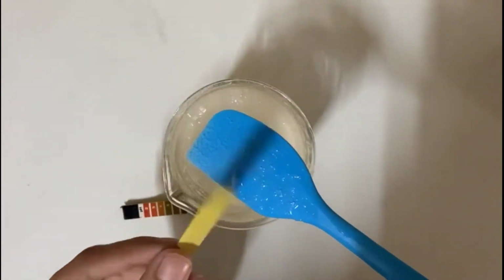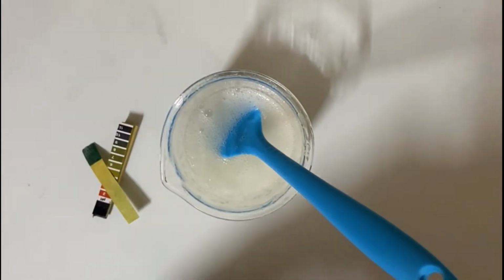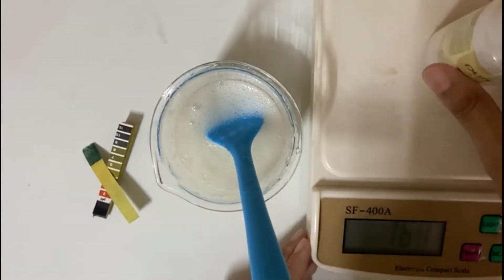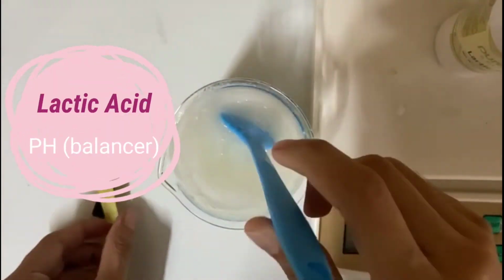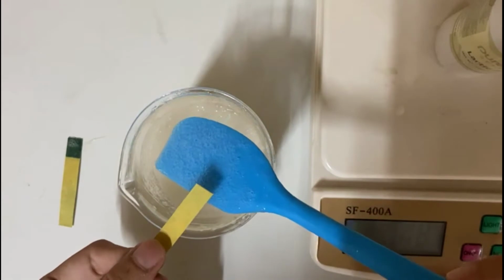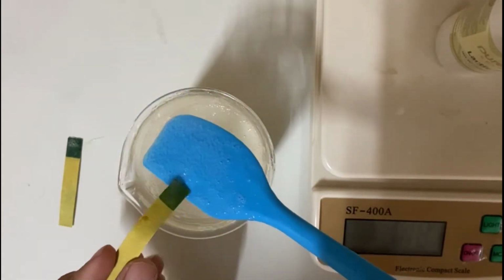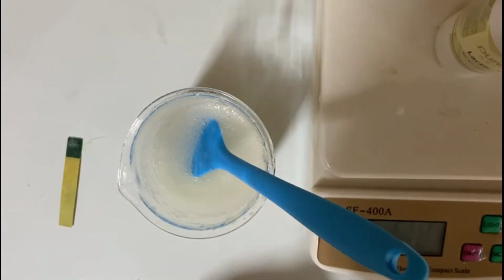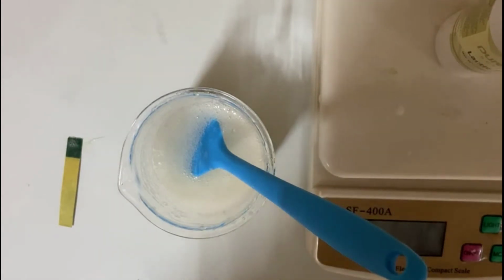For checking the pH, I am using pH paper. At present, the pH of the product is between 9 and 10. You can see here, that is basic, but the pH of hand wash by BIS is between 5 and 6. Hence, we need to add lactic acid for lowering the pH. Again, this pH paper turns green, meaning pH is between 8 and 7. So again we have to add lactic acid.